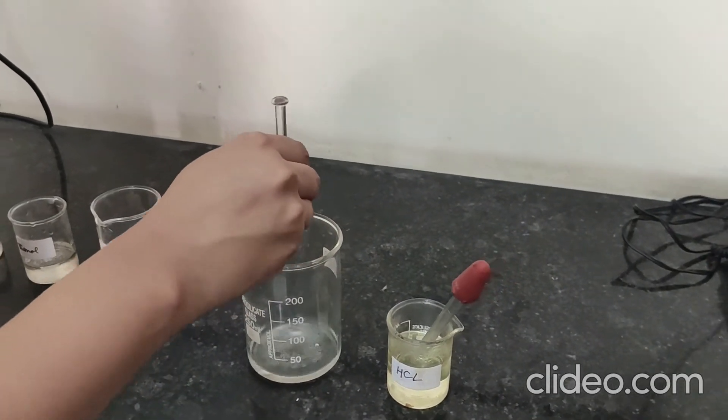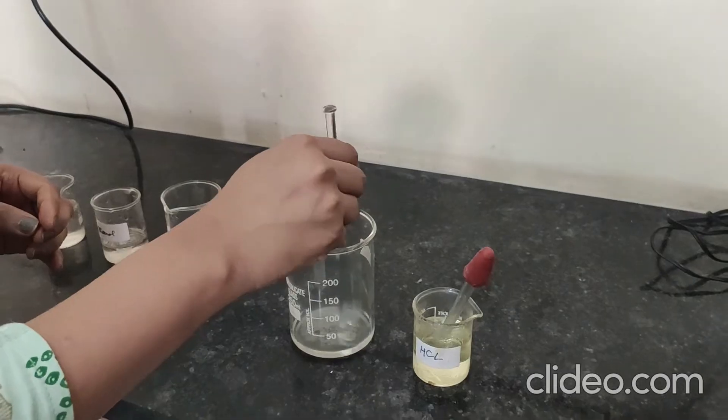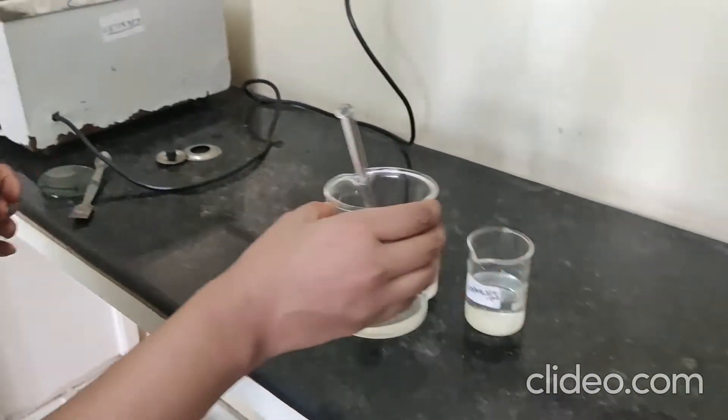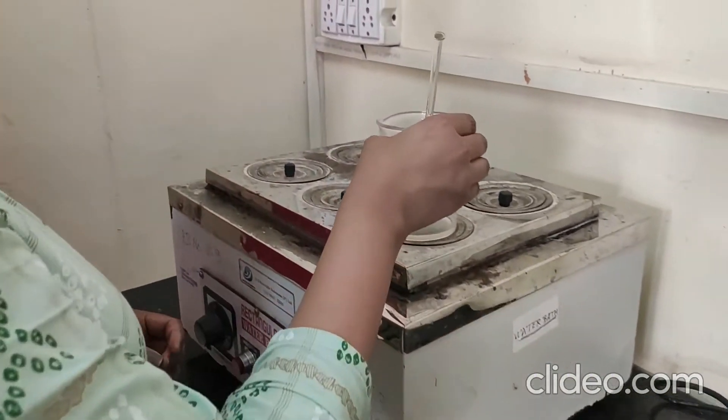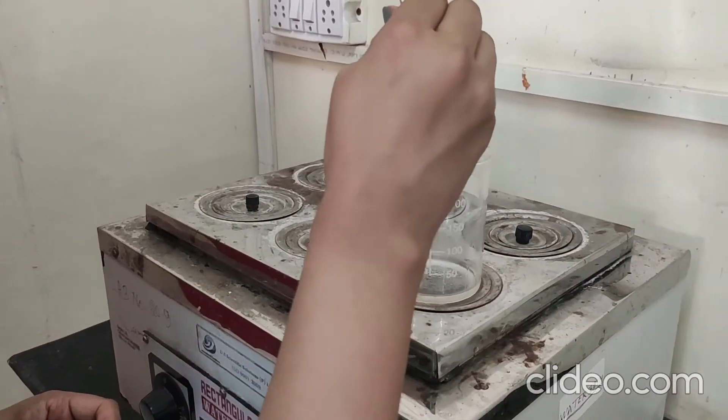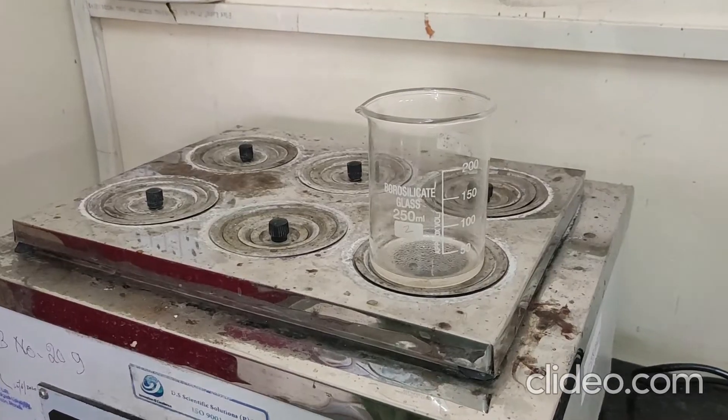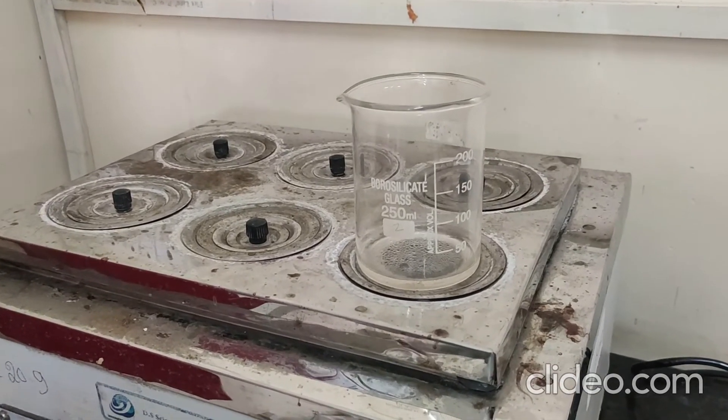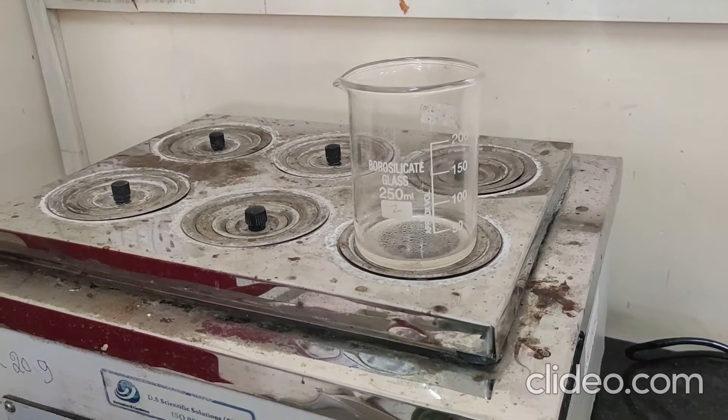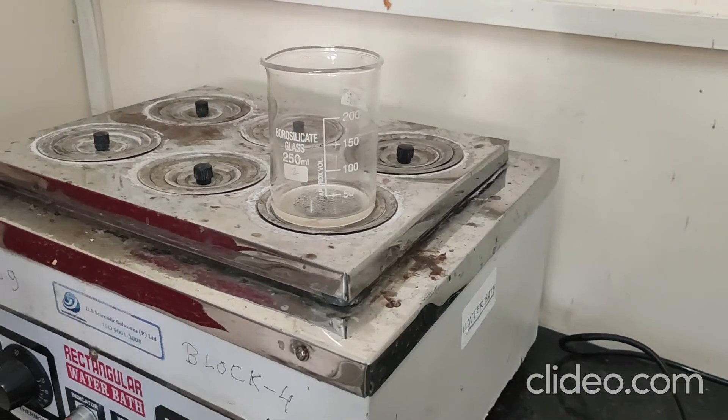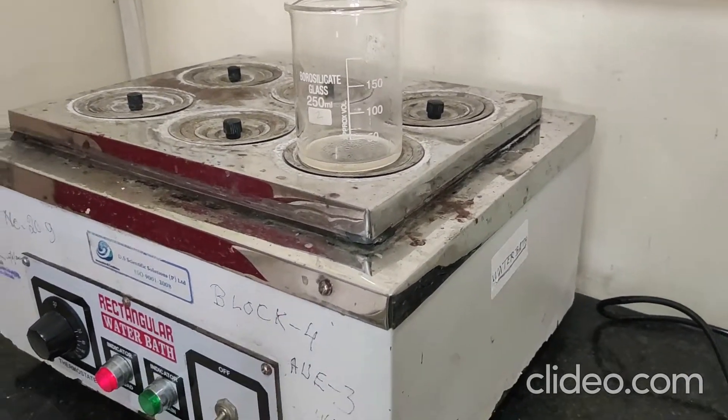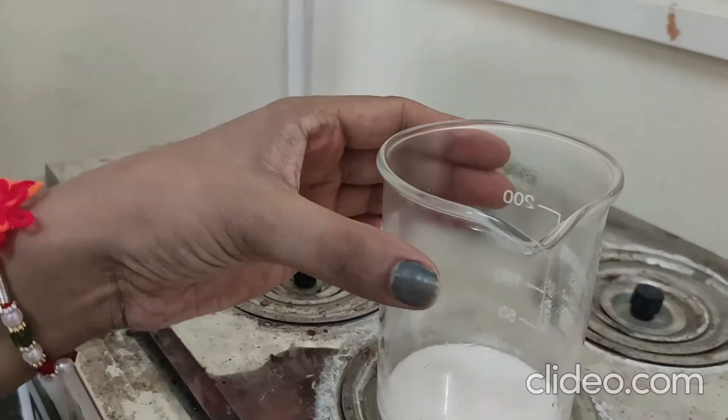Now heat the content on water bath at 70 to 80 degree Celsius temperature. You have to heat it till the solid mass will pop out. The solid mass has appeared.